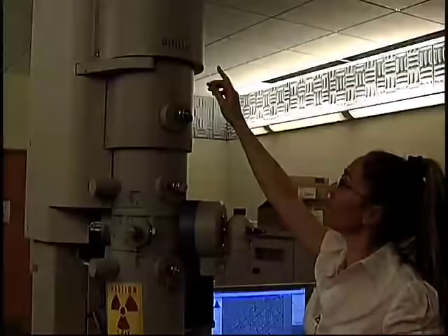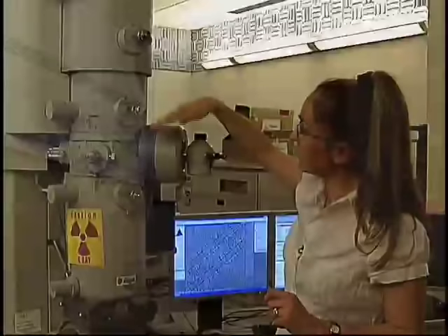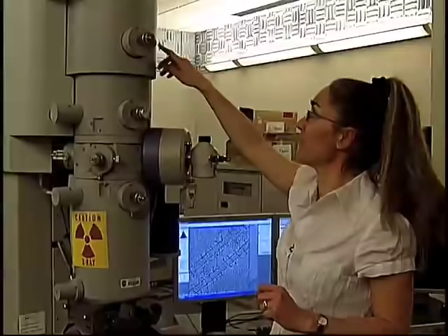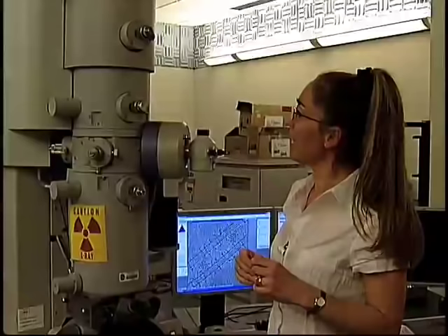Now I will show you how an electron microscope looks like. This is what I would call a middle-of-the-range electron microscope. The whole story starts up here with the electron gun, which is where the electrons are produced. They shoot down the column, which is maintained at very high vacuum so as to minimize scattering of electrons by residual air. At each stage, you have electromagnetic lenses that are used to deflect the path of the electrons. Earlier on, there are two condenser lenses that control the illumination of the sample — how bright and how large is the area being illuminated. Then comes the most important lens, the objective lens, right in the middle.